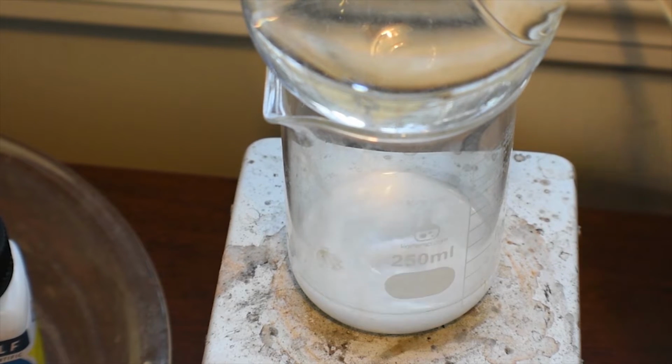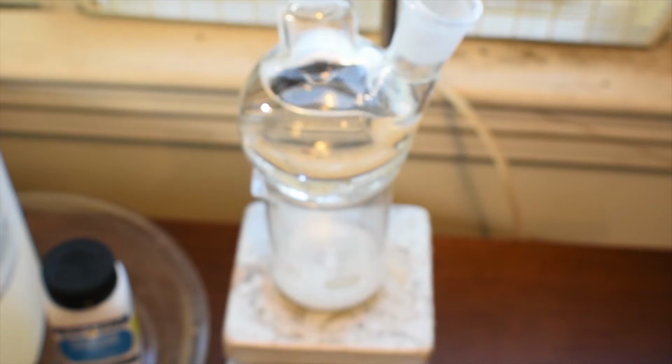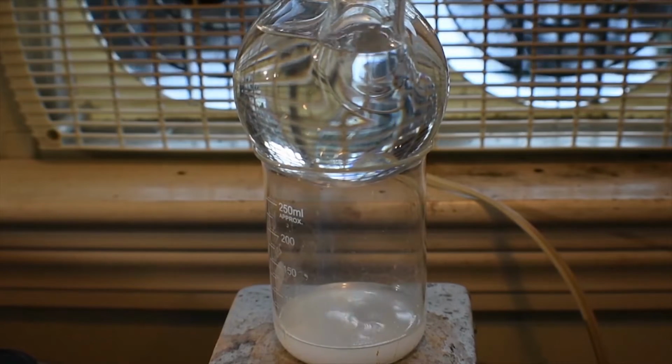And I'm also going to remove this metal piece on the back of my hot plate. I'm going to have to remove that as well, because I don't want it to rust, because this will probably destroy it. With the amount of nitrogen dioxide that's going to come off, it's not going to be good for it. So let me go ahead and remove that. Okay, going to turn on stirring here.